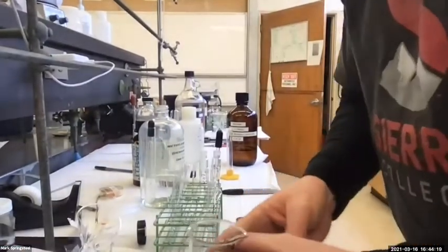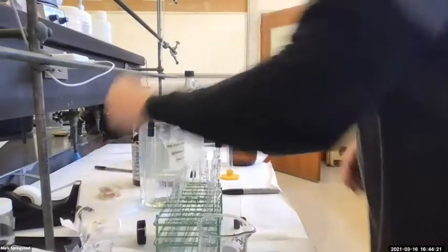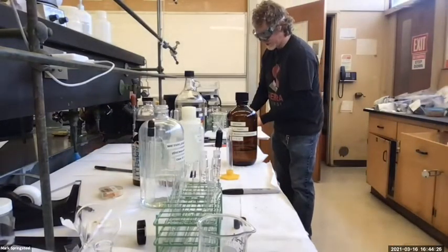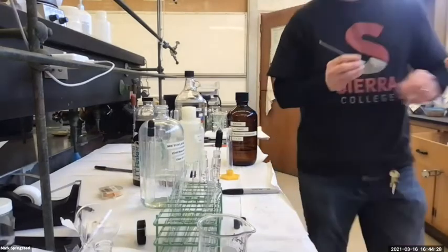It's looking pretty good. Thanks for hanging with me, you guys. I know I've gone a little over. If you've got to go, don't feel like you have to stay, but I'll just skip. Maybe I'll do an IR of this one, and then I'll get the other one without you, unless you want to hang.